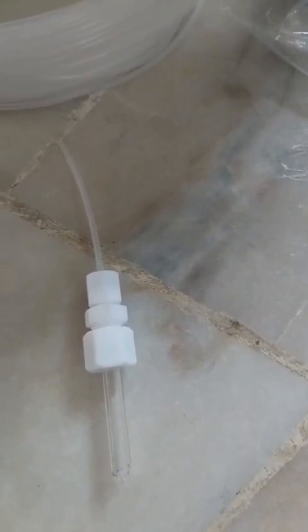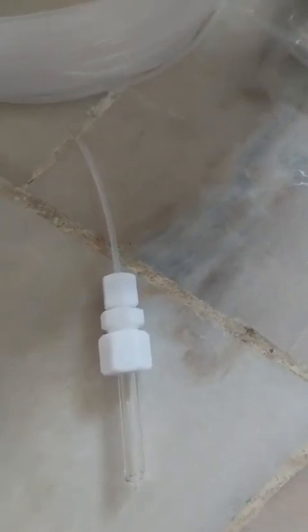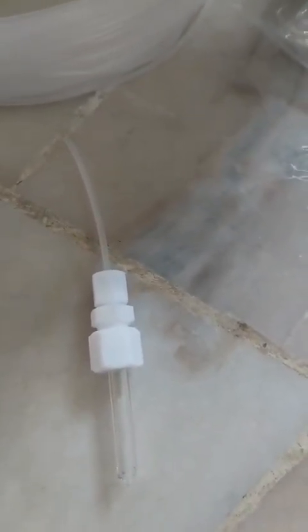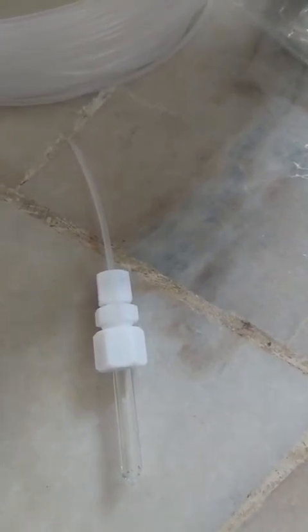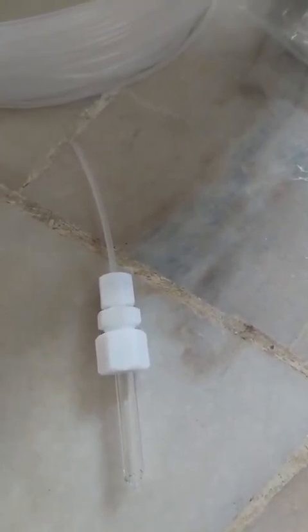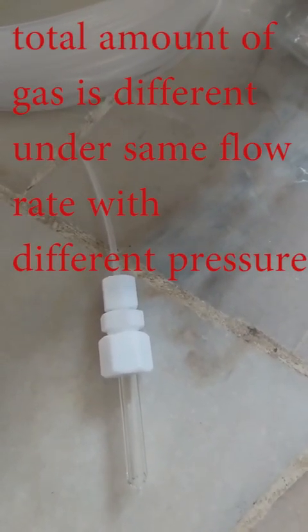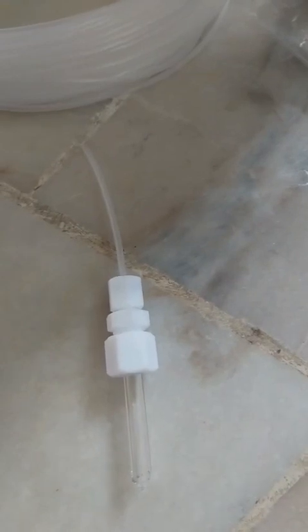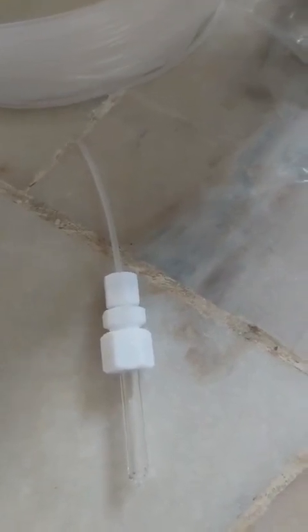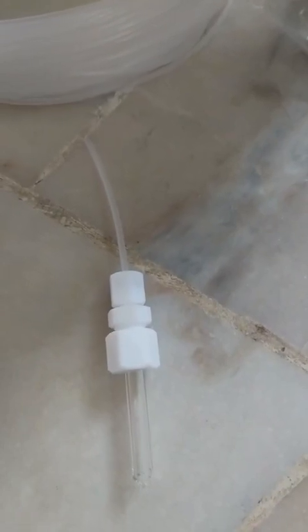You can choose to control or not control based on the standard method or the experimental design that you require. But the total amount of gas provided into the system is of course related to the pressure that is controlled, because the total moles of gas molecules are related to the pressure provided into the system.